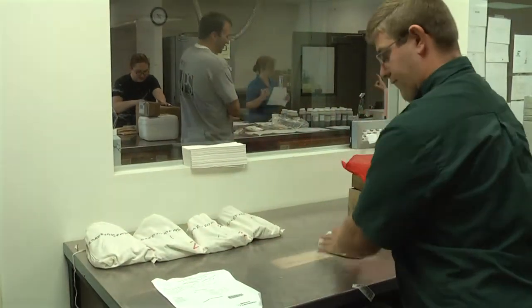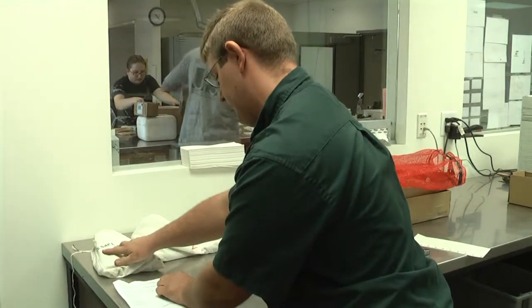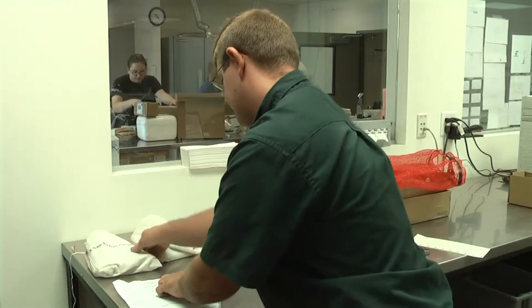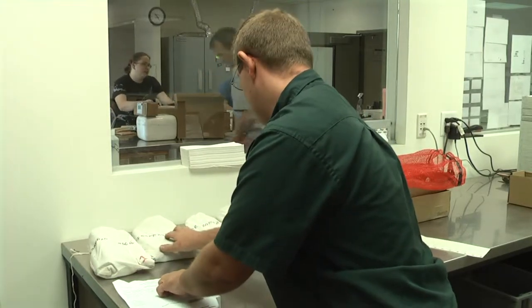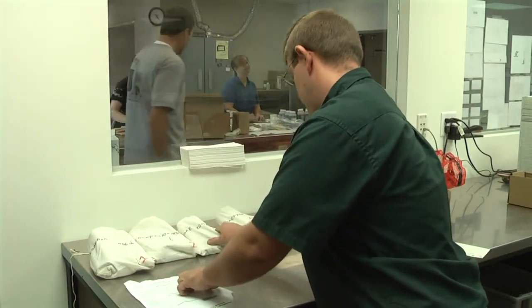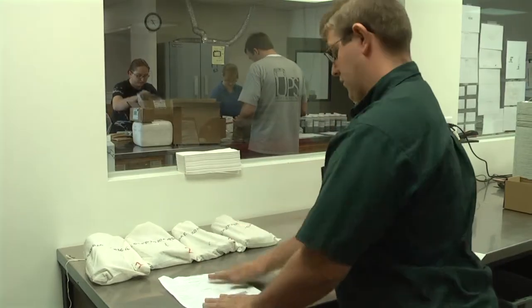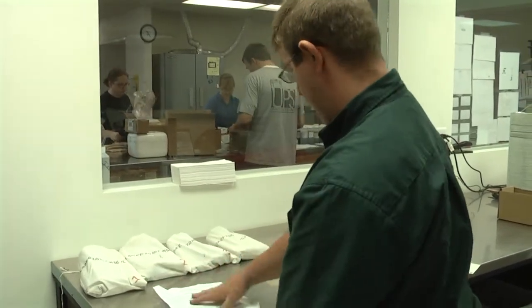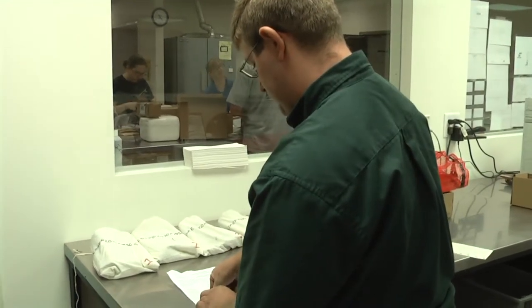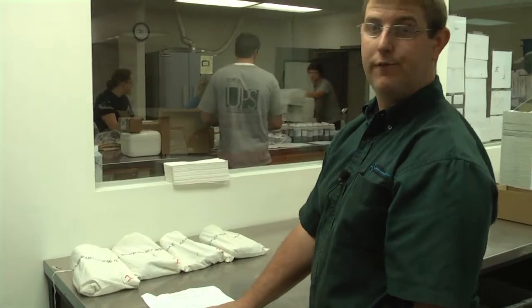The samples are laid out one through four. Now we're going to jump up here to the farm ID for the on-farm network and make sure everything matches on every single bag. The sample IDs look good — they match the paperwork. So what we're going to do is attach a lab number to each individual sample so we can track them from start to finish through the lab.